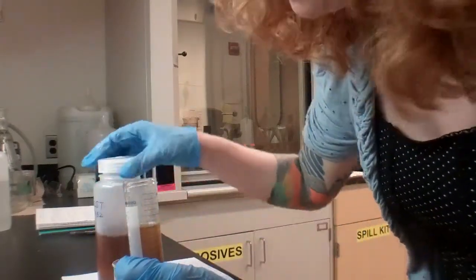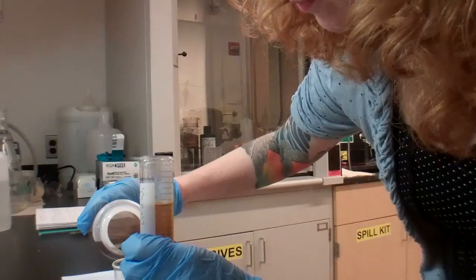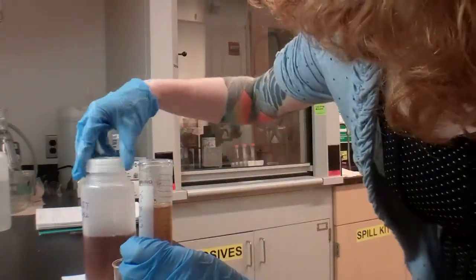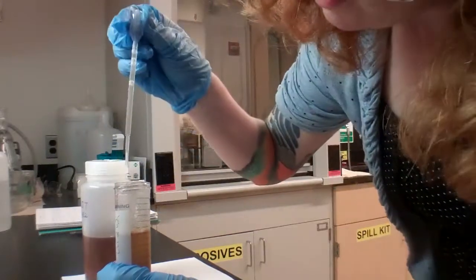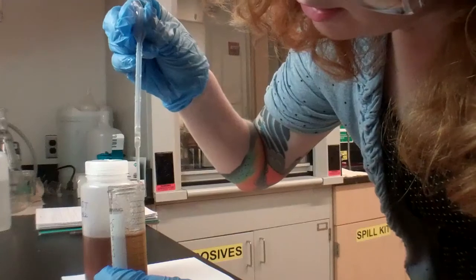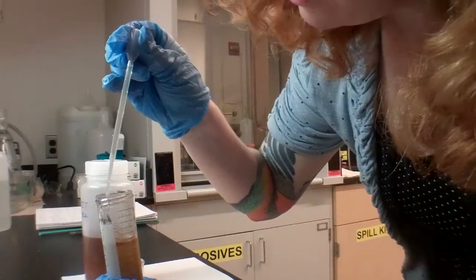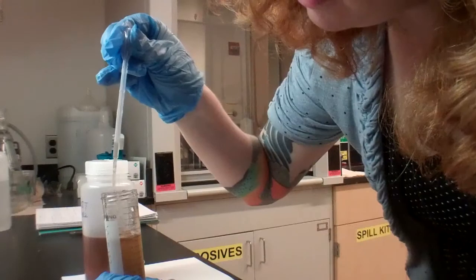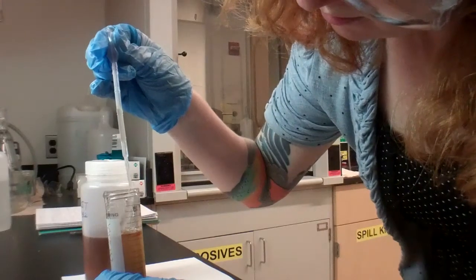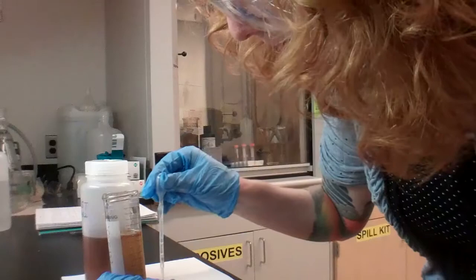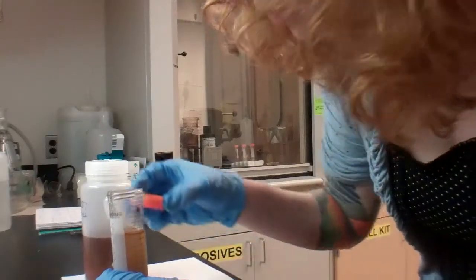I'm going to add just a bit more, and now we're going to pipette all of the bits of grains that are stuck on the sides. Pipette. And now we've got to get all those little bits into the LST. And I also want to see, just in case there's any grains stuck to the top of our vial here, I'm going to whoosh them out and put them in as well.